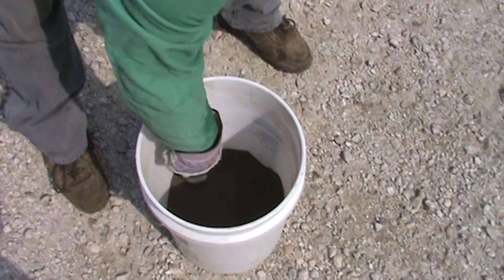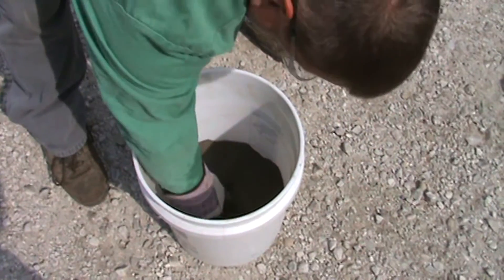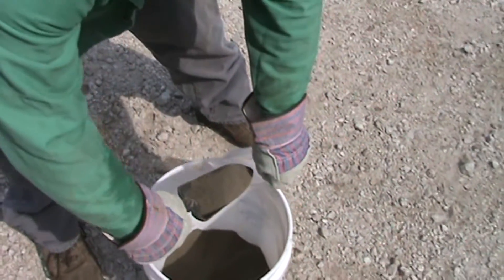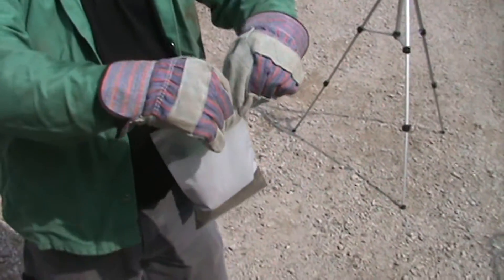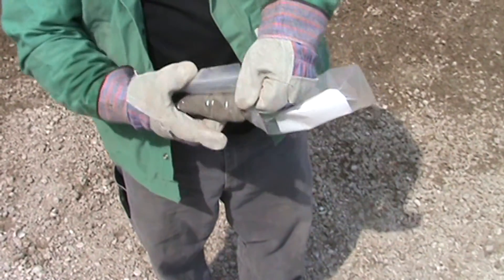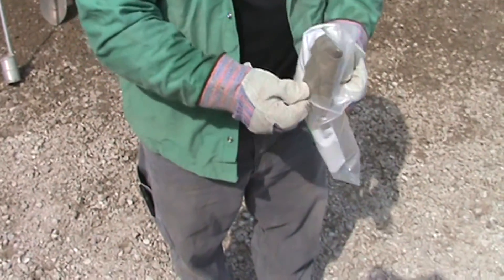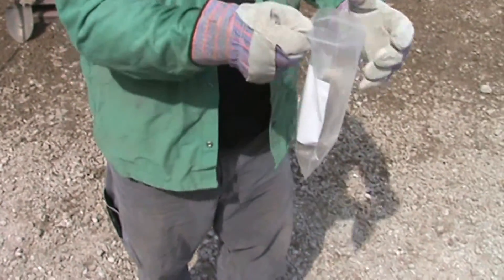Each individual sample should be collected in a bucket and mixed thoroughly. Once the waste within the bucket is homogenous, you can quarter the waste and scoop one quarter into your sample container and keep the other three as retained, or for other principals who may want a split of the same sample.